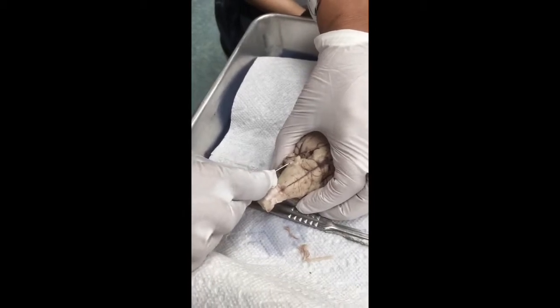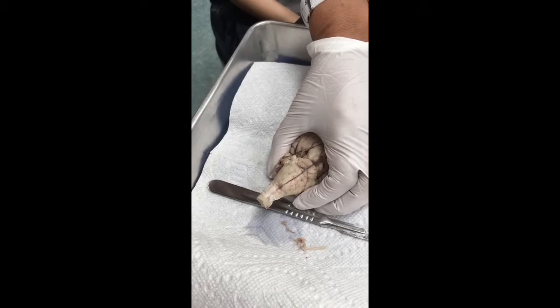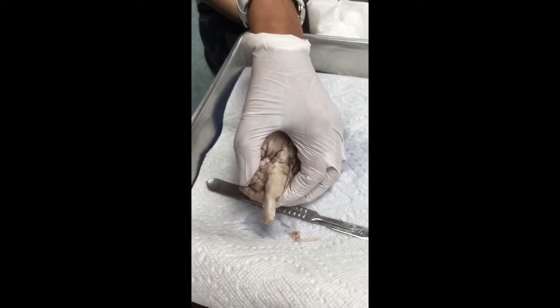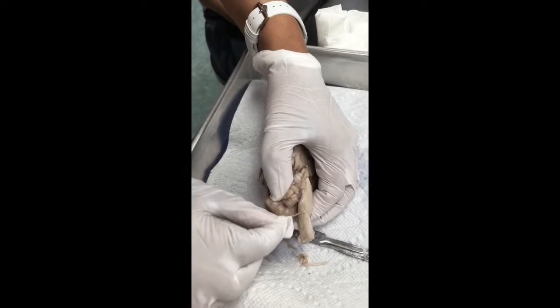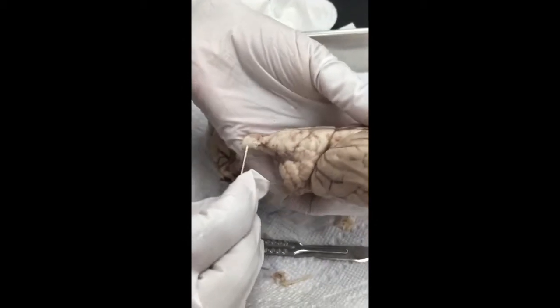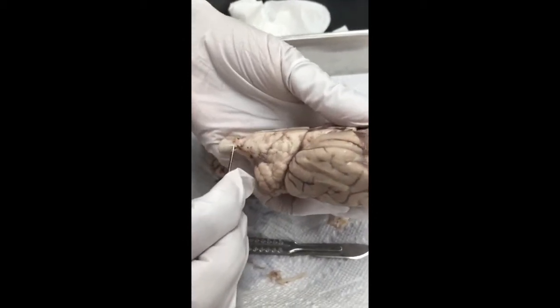You see, that's the hypoglossal, vagus, glossopharyngeal. Then we have this guy that is really, I saw it last time. That's the accessory nerve. Over here, that's the accessory. You see it? Here we go. Oh, that's so white. Yeah, it's always white. That's the accessory nerve.